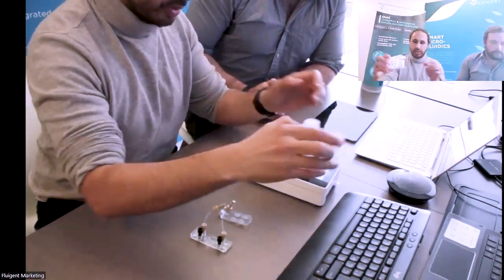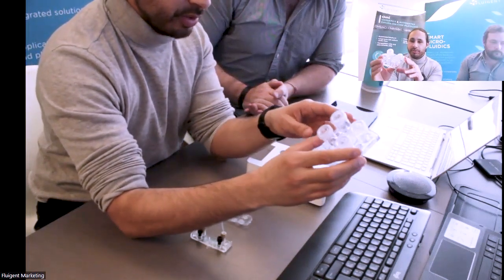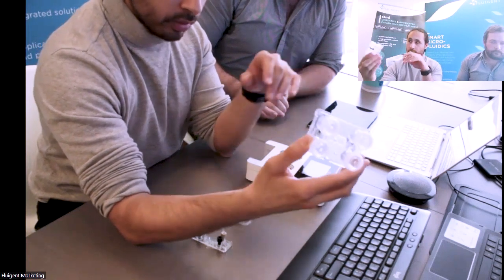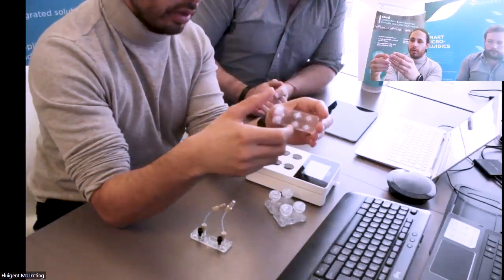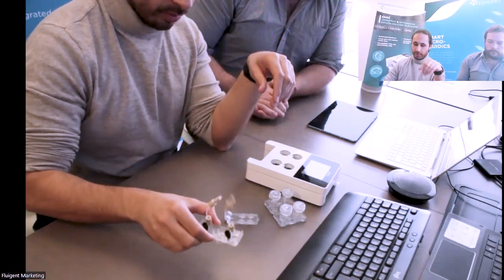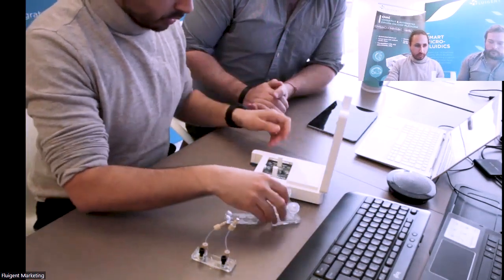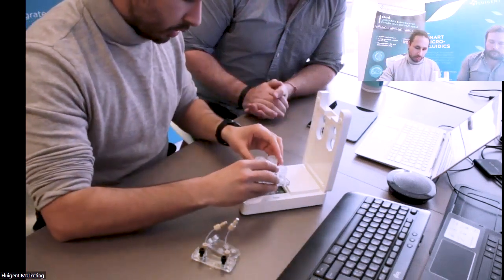Then I have my cartridge here, which is what William presented before with the 4 reservoirs, RI, RO, I, and O. And then I have my microfluidic chip adapter, and a standard microfluidic chip. So the idea is that I will open my OMI here. I will position first my cartridge in this way.